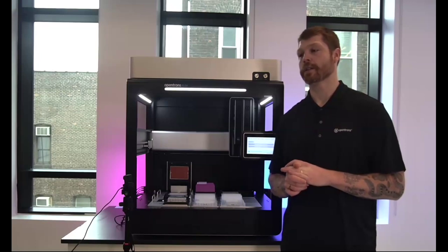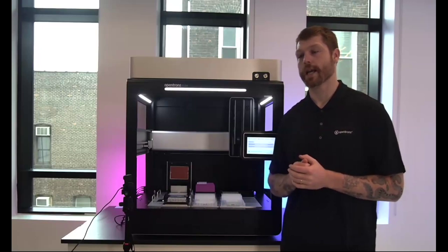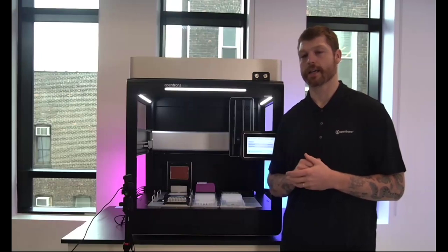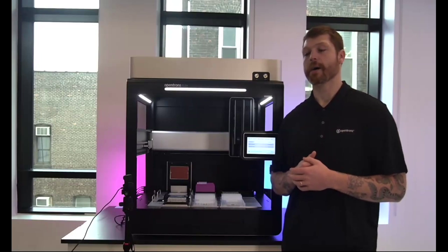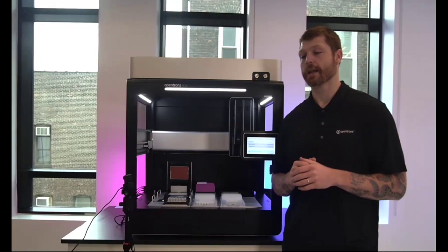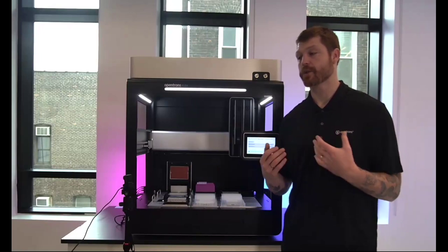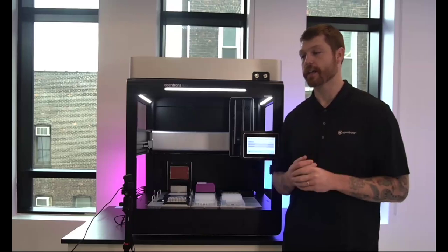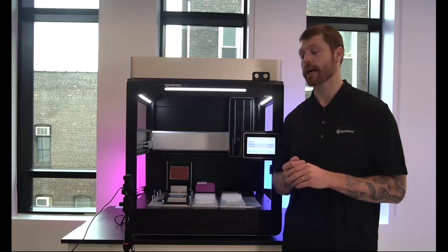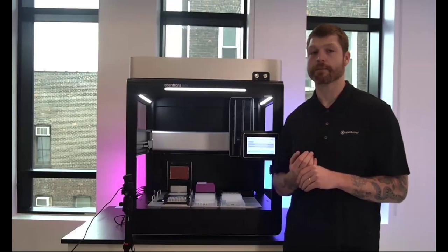Oh, very, very good question. Unfortunately, I think the best way to do that would be to go in and update it at the protocol level to specify that you are now using a different pipette. With our runtime parameters, you can parameterize the pipettes that you are using as you move forward, so that you have the ability to very readily switch between those two configurations and create much more dynamic scripts. However, the upfront lift would be to still switch those over. Again, I would definitely recommend parameterizing those and going with that pathway.